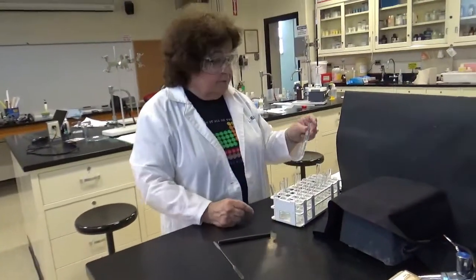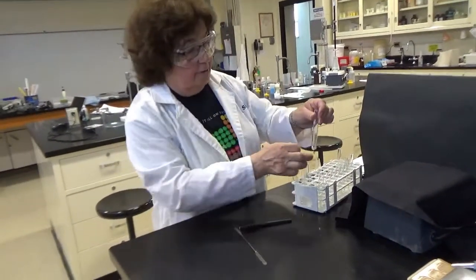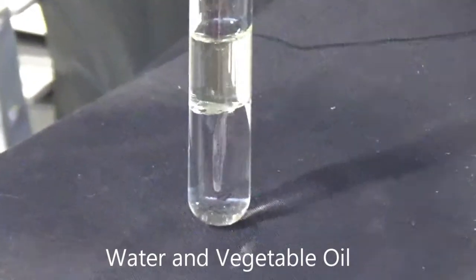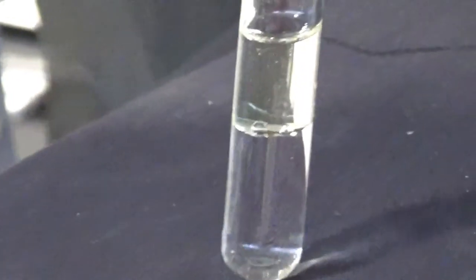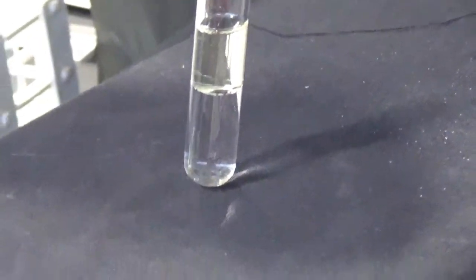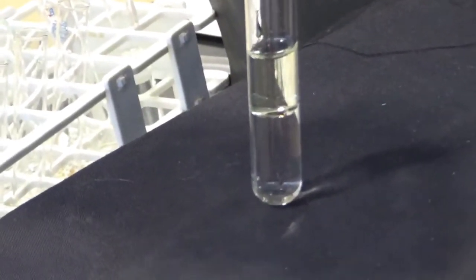And our last one is vegetable oil and water. So I'll try to mix that up a little bit. Not too easy. And remember, the vegetable oil is a yellowish color. I think maybe you can see this quite clearly and make your observations about these two liquids.